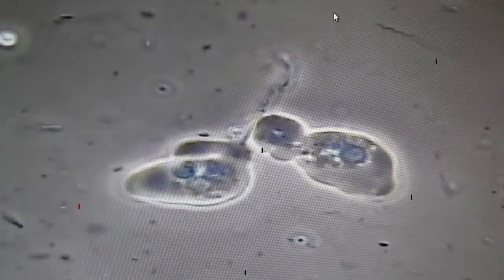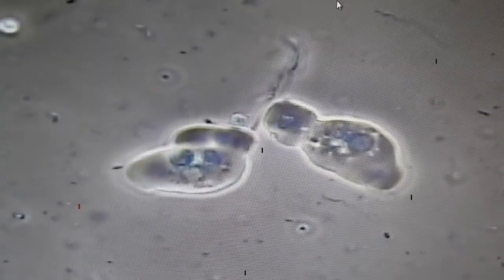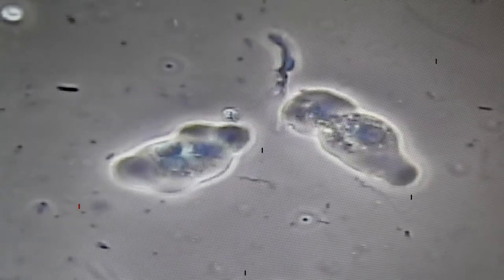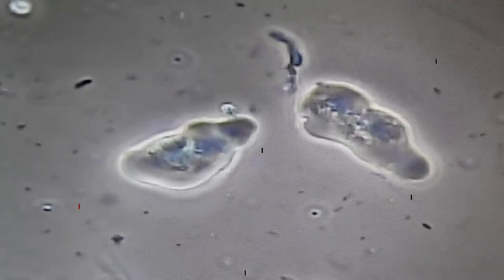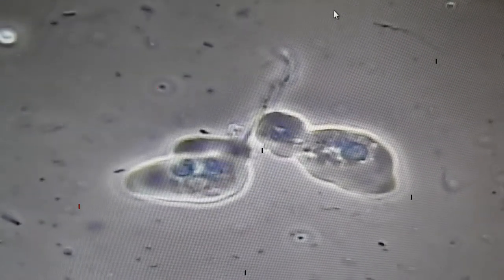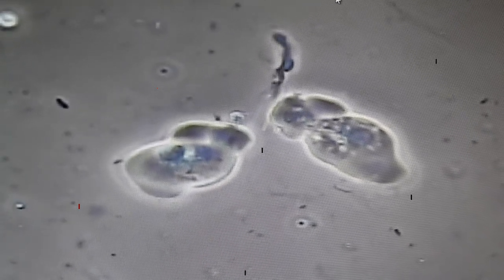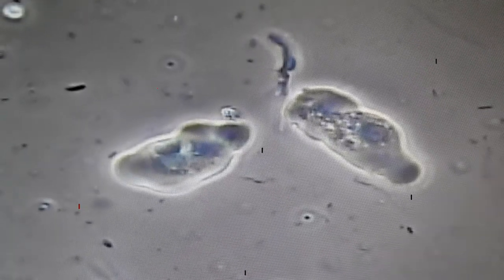In a deeper pocket where there's a lot of plaque, a lot of infection that's been going on for a while and a lot of spirochetes, it's not uncommon to see amoeba, which you're seeing in the field here — here are two of them. This is zoomed in just a little bit more, so these are slightly larger than they might appear in the field, but typically they're going to be the size of maybe one or two white blood cells.